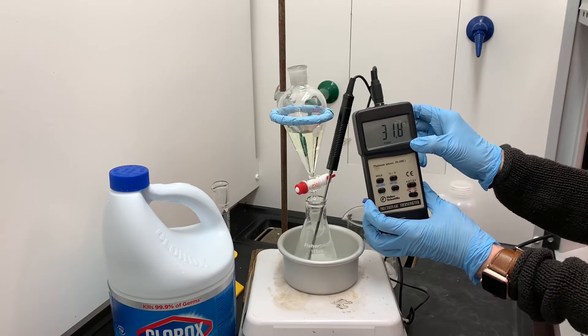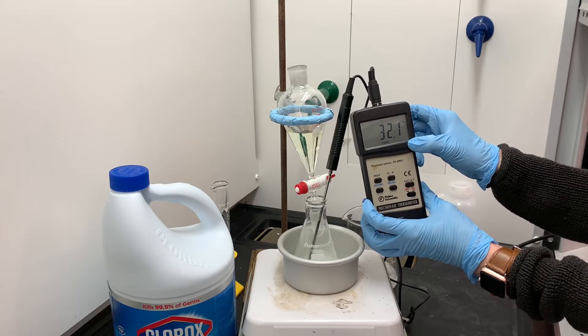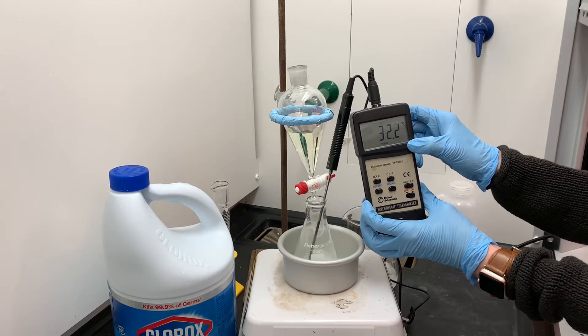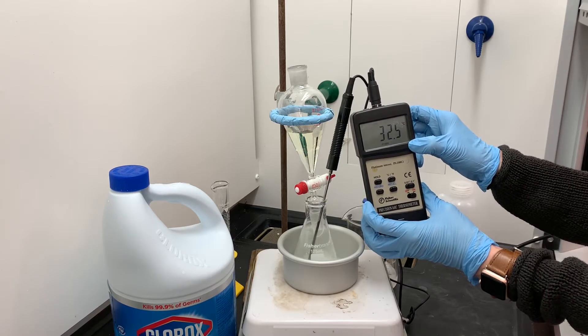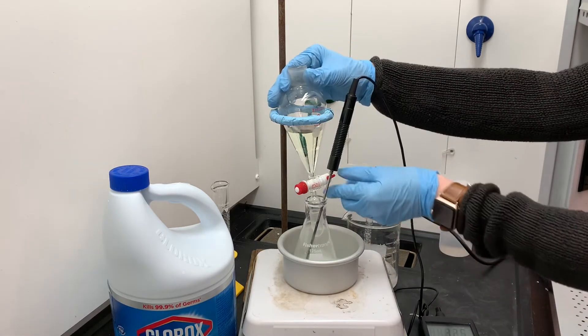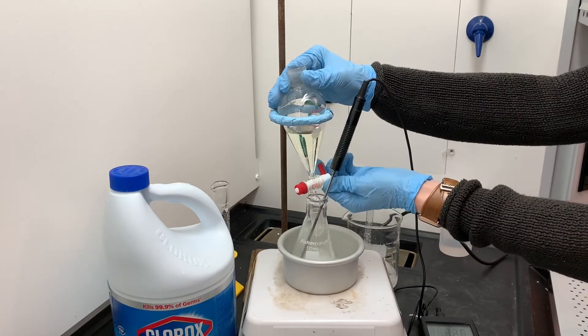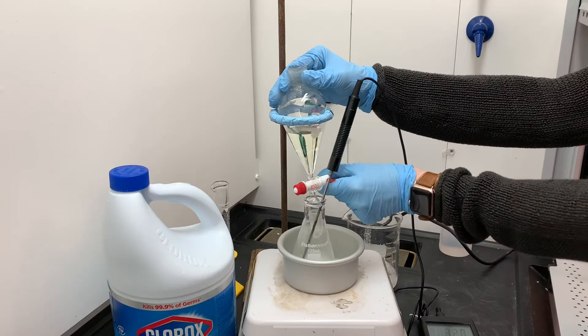So I'm just going to be repeating this process over a period of at least 10 minutes, adding a little bit of the bleach, watching the temperature just to make sure that it doesn't jump up too high, and repeating this process slowly until all of the bleach has been added.